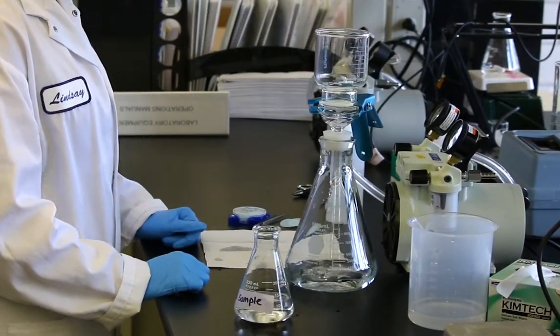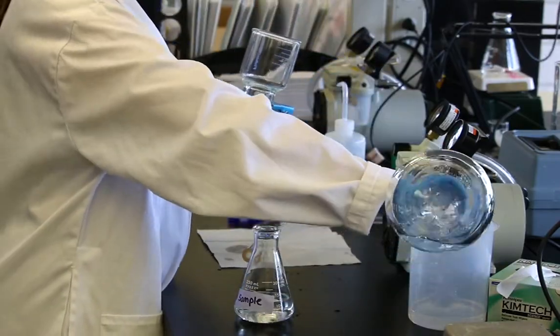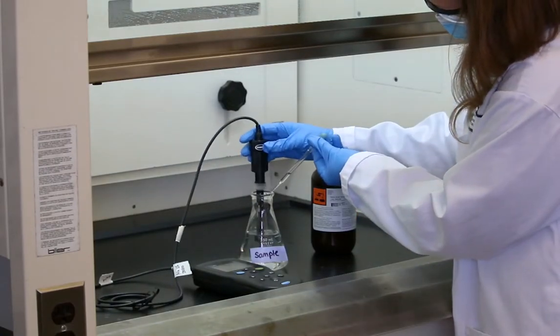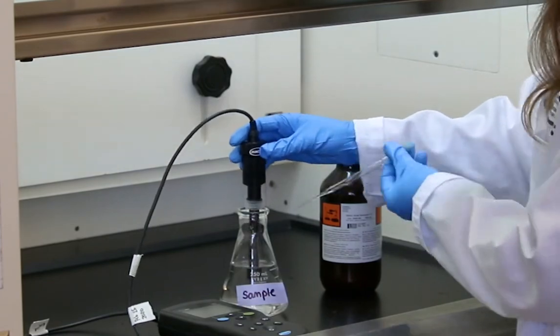If you want to only measure dissolved manganese in the sample, filter your water immediately after collection. Samples can be acidified for later analysis and stored up to six months. Please refer to your method for instructions.